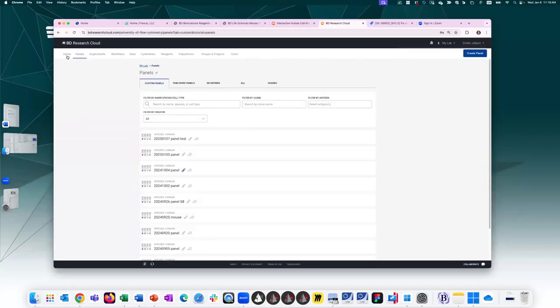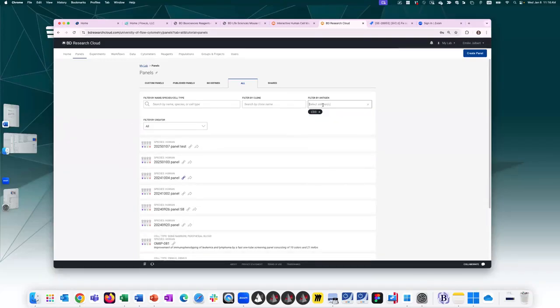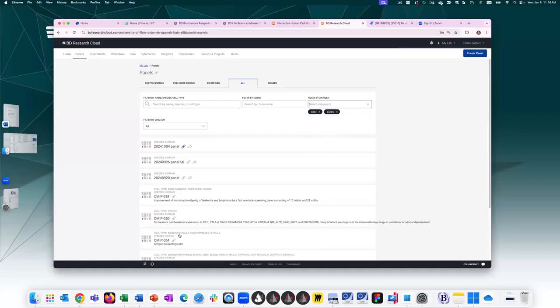So coming back to the panel section, if I click on the All tab, I can search through all of these panels, my own and published panels, to see if there's any that suit my needs. You can put multiple antigens here in the filter, and it will restrict the list to only show panels that contain the markers of interest. So CD45, for example. Now it will only show panels that contain both CD3 and CD45. So you can put a long list of antigens here and see if there's any published panels or previous panels used by other lab members that might suit your needs.